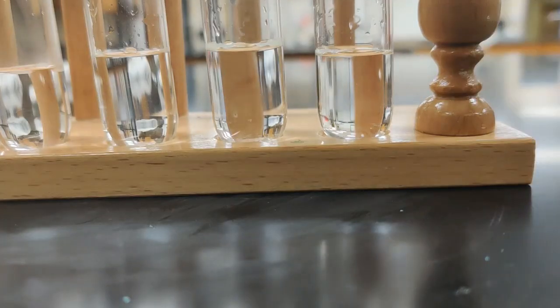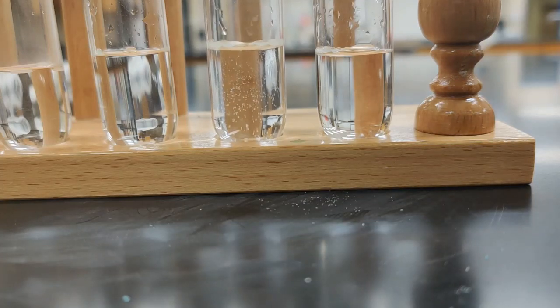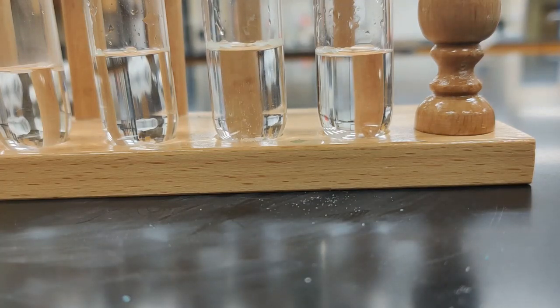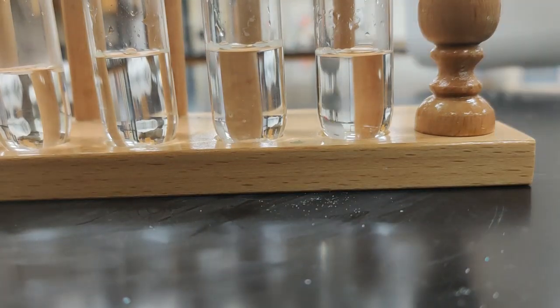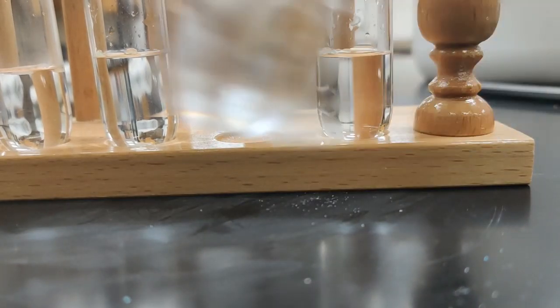So we'll get our container of glucose and tap, tap, tap it in there. You can see some of those solid bits floating down. And just like we've done in the other ones, we want to go ahead and agitate this. So we'll stir it back and forth and agitate.